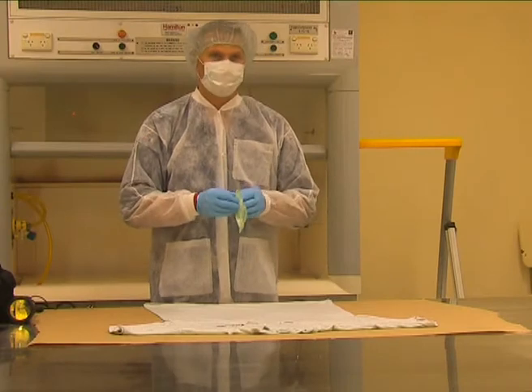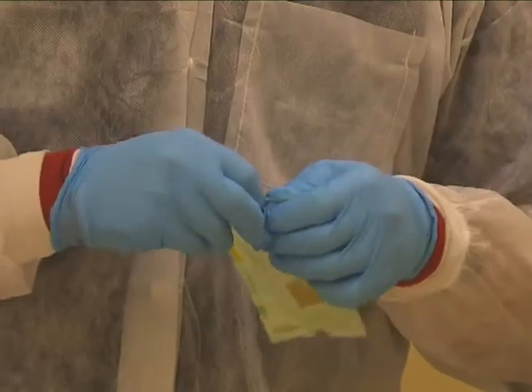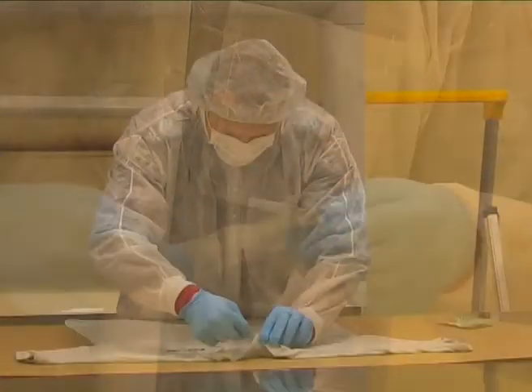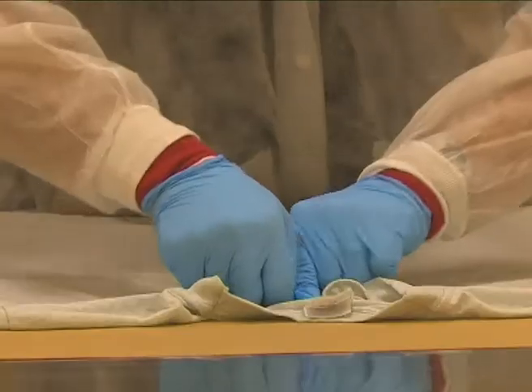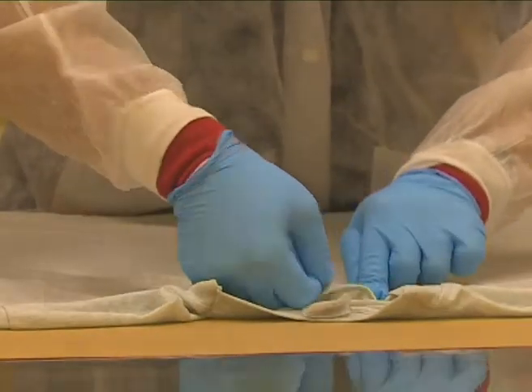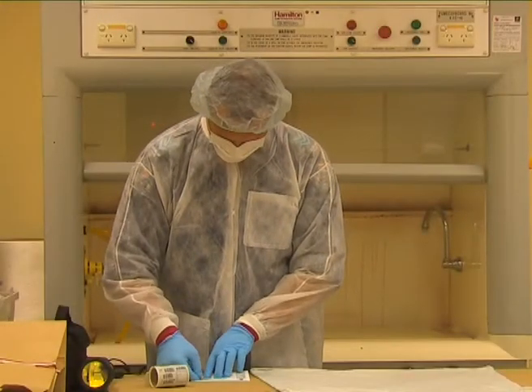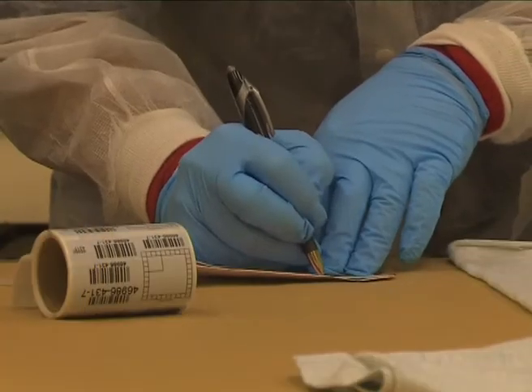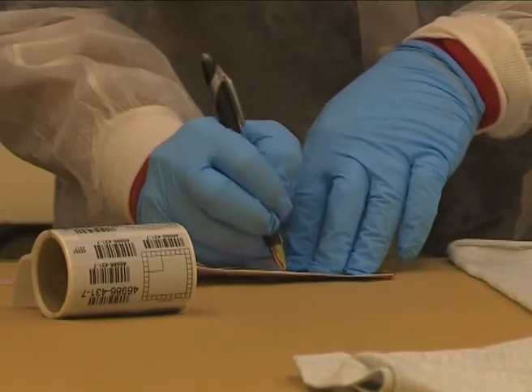The next procedure is a DNA tape lift. The scientific officer takes samples from around the collar and arms where the light has shown some hotspots to be. He then places his sub-sample into a tube, barcodes it and sends it to Queensland Health Forensic Scientific Services.